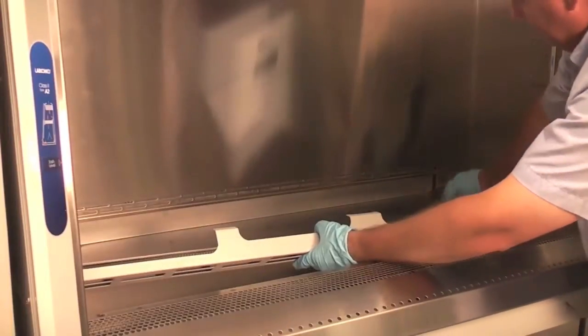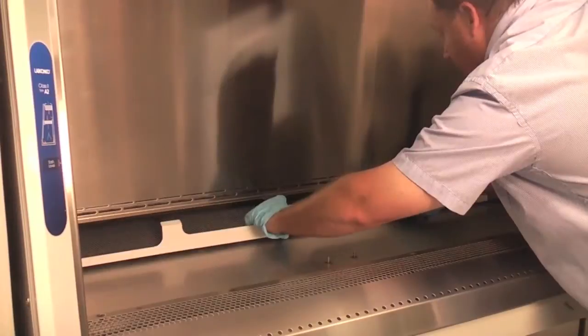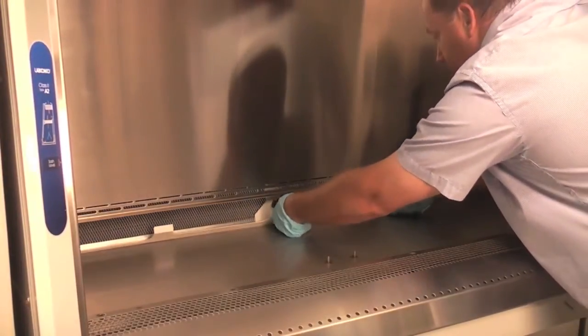Pivot the new pre-filter system in place. Be sure that it is rotated all the way in with the knob facing forward and brackets facing up.